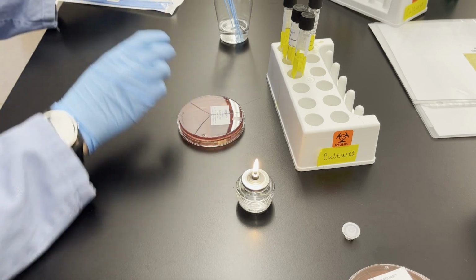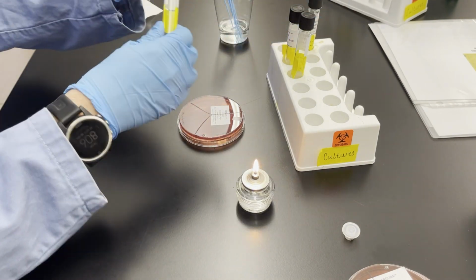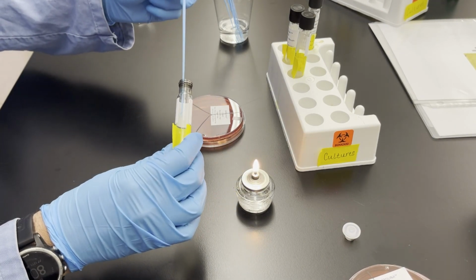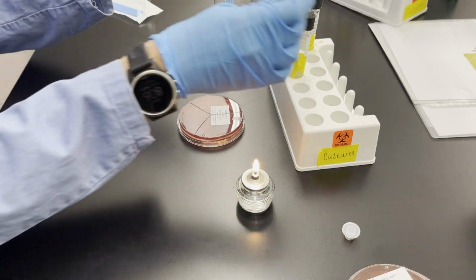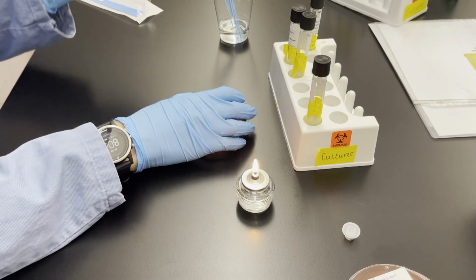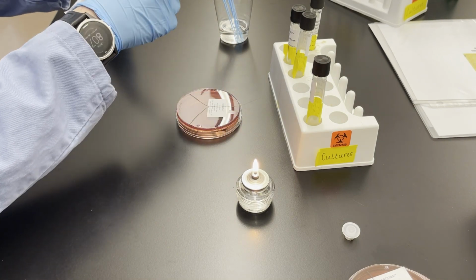And the final plate is the MacConkey agar. So we're going to, again, repeat the procedure. So starting with a loop full of E. coli, I'm going to grab that and then, of course, flame the tube prior to closing. So that's the last time I'll use the E. coli in this experiment. So inoculate the plate with E. coli, discard the loop, grab a fresh loop.